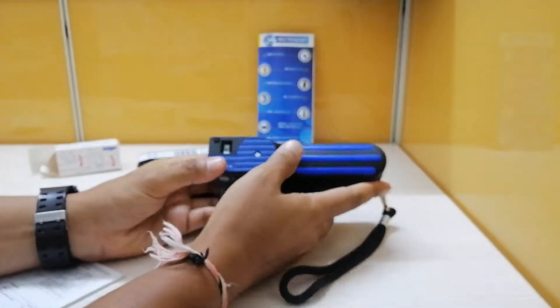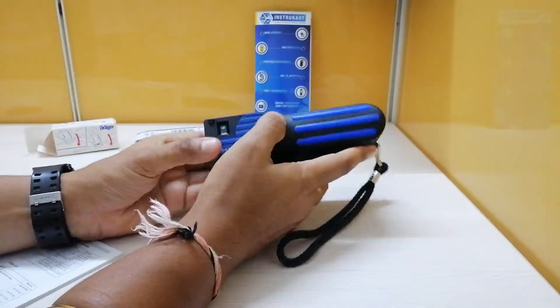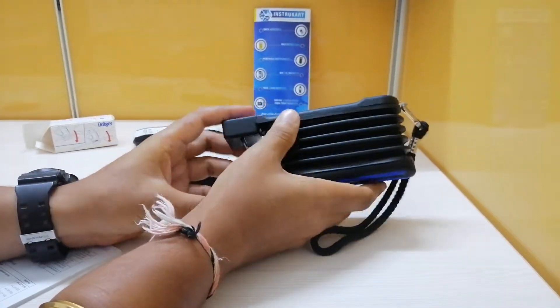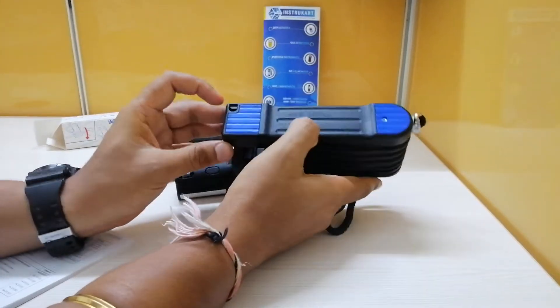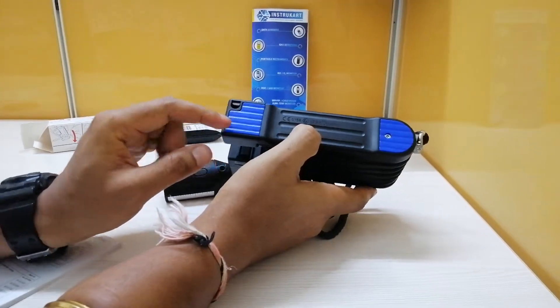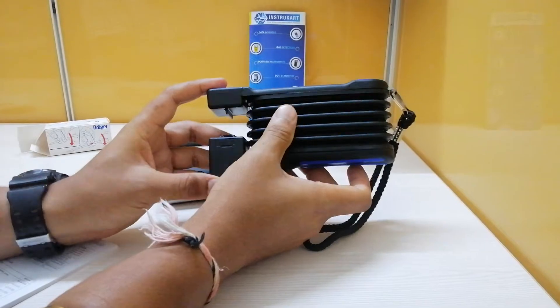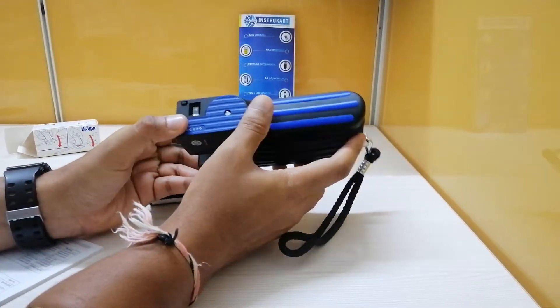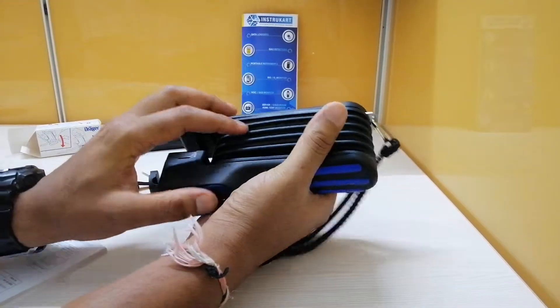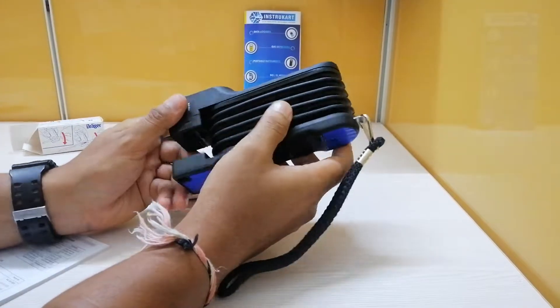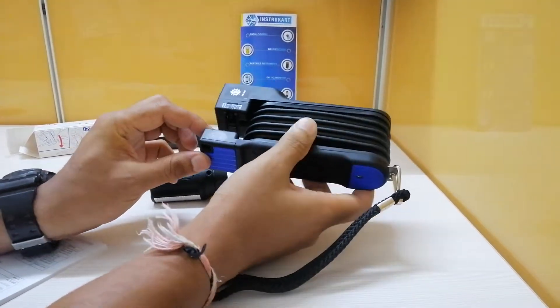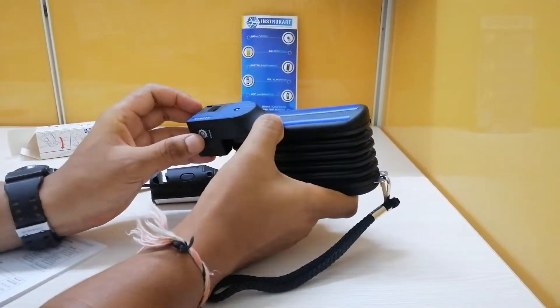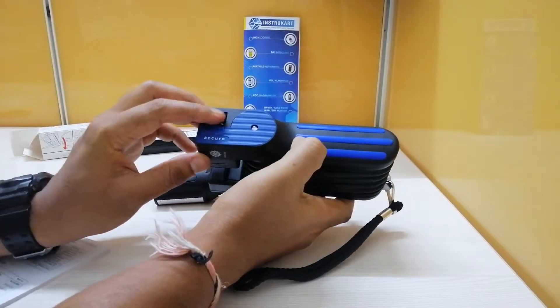I'll make you familiar with this instrument. There are several parts including the tube opener with a ceramic cutter, the cover plate, the socket, the rubber bellows, and the lower pump plate. This is the stroke counter reset button and the stroke counter.